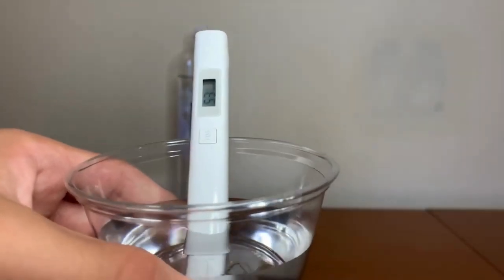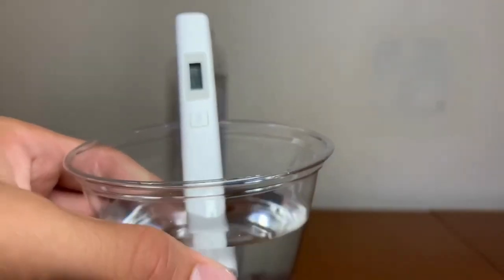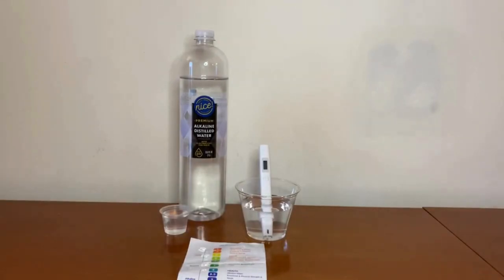The TDS right now is 53, which is water with a low mineral content.